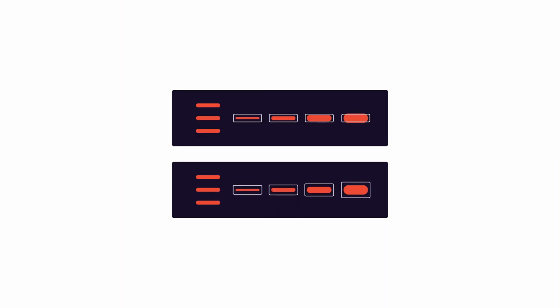Some software packages also require you to draw the same size quantification boxes around every band. Now this is a problem because, as we all know, Western blot bands tend to be different sizes, so one size fits all doesn't really fit at all. Ideally, you should always choose a software that allows box sizes to be different and appropriate for each band, and which takes those box sizes into account when producing final signal values. Empiria Studio software works in this way.